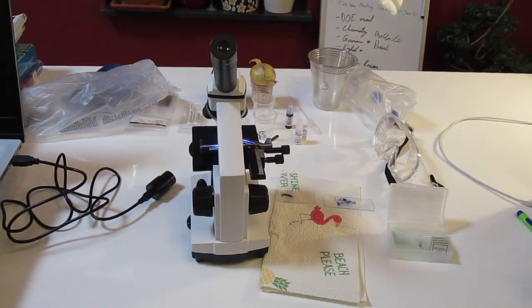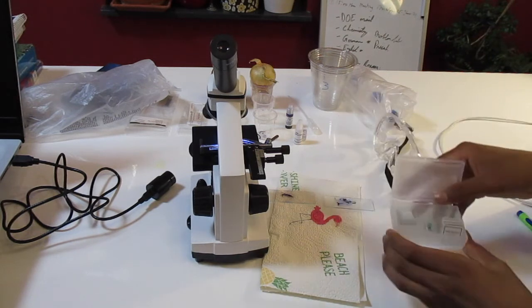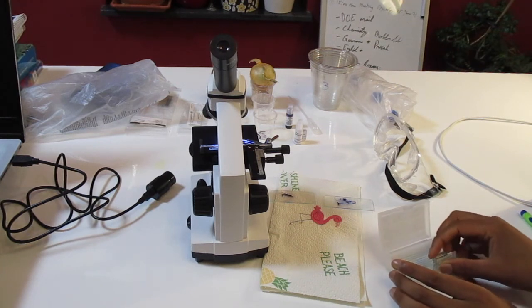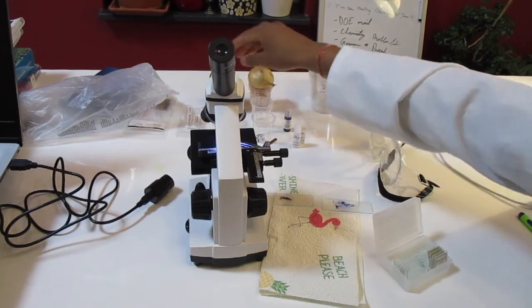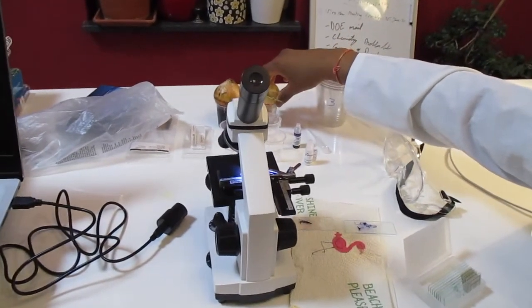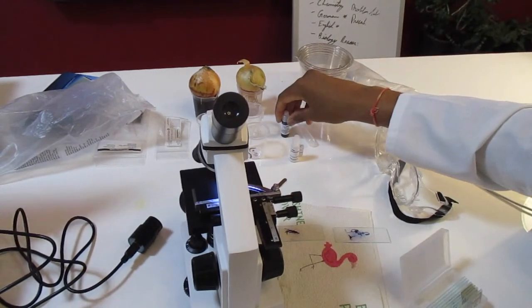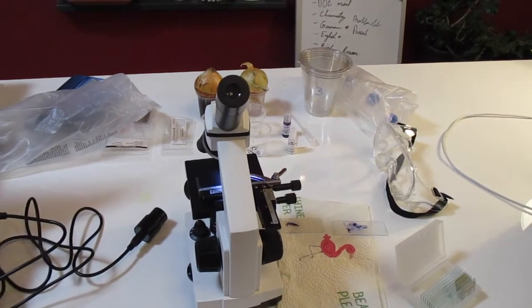So here are the materials. Here in our materials we have the microscope slides, we can see here. And on the microscope slides we have the microscope cover slips, which are very small but can be seen. We have the microscope right here, and then we have one onion in the caffeine solution here, and one onion here in distilled water. Then we have our 0.5% aqueous solution of the toluidine blue. We have our 0.1 molar solution of the hydrochloric acid. And that was it for our materials.